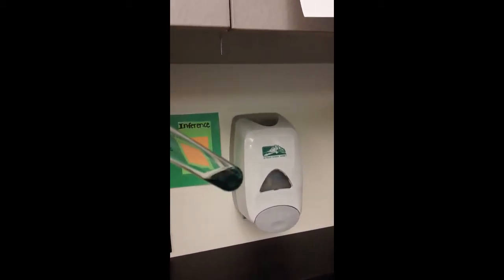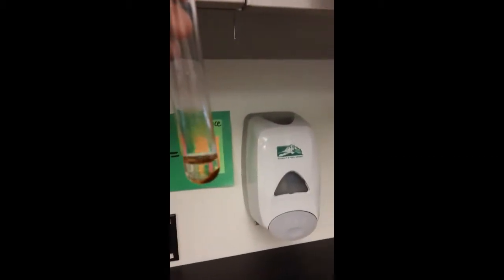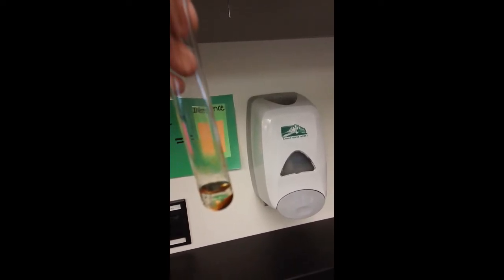Do you notice a solid? It looks like it's only a liquid and that it's a dark green, kind of a translucent liquid. Okay. Now we're going to have our Fe. So here, looks like we do have a solid. Note the color and how much. Make sure to note the solid and the liquid.